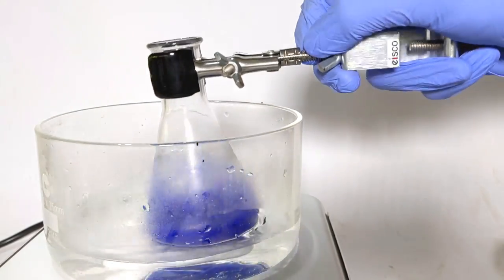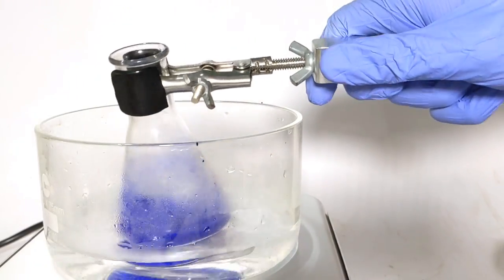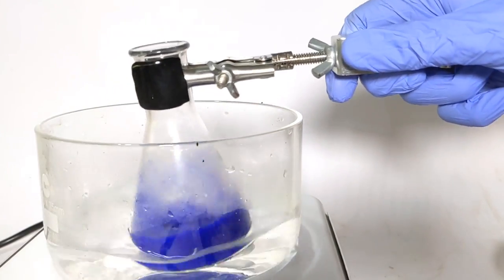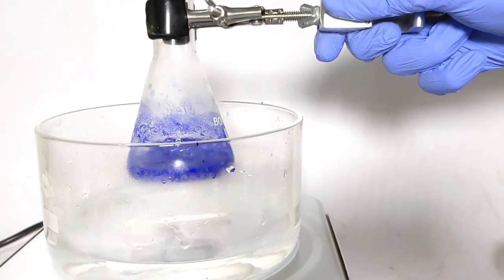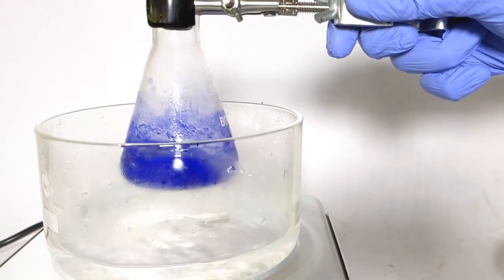So get ready for that nasty smell. Do it outside or in a fume hood. The literature says everything would dissolve but it didn't seem to work for me. I tried the same experiment 3 times each time with 5 grams of copper sulfate and I failed.